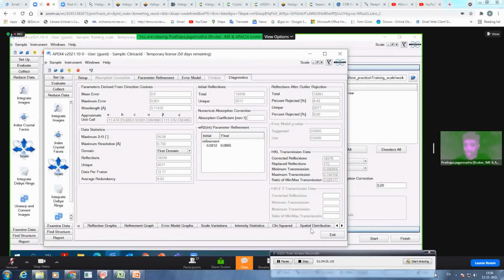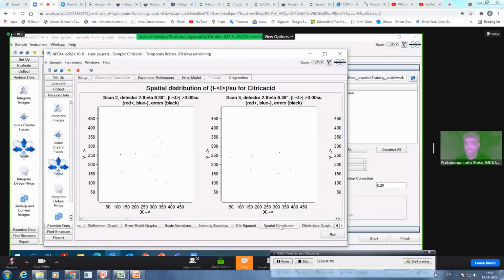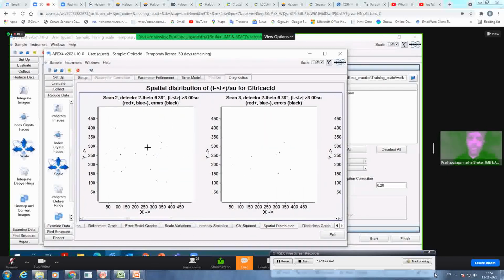So for example, you have this Diederichs plot here, which is plotted as I by sigma I versus the log 10 I. You should find a sigmoidal variation, and then it should go better than 30 for very good data. But on reasonably good data, you get around 20, 30 or so on, but you should see that kind of distribution. And the spatial distribution, which is plotted against each run, you should see maps without any features, and not too many reflections missing. As you can see, in each run there are not too many reflections which are missing. If there are too many, then either it is overestimated or underestimated, or something is blocking it. So make sure that you don't see too many reflections here.